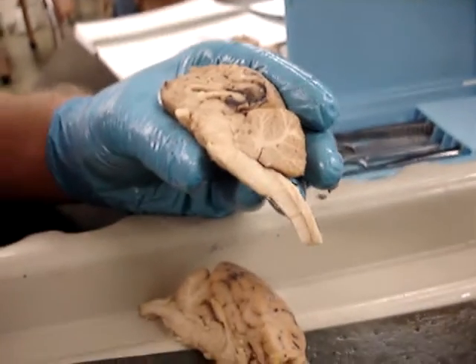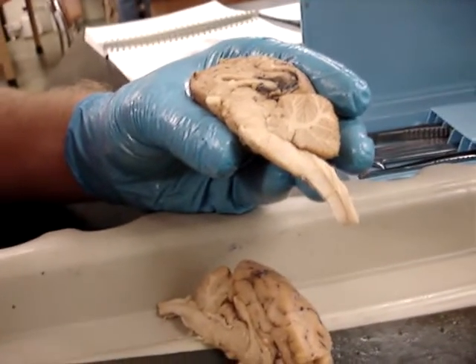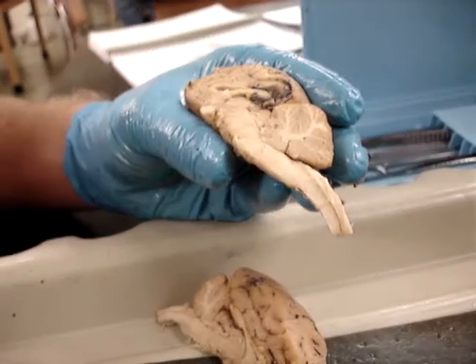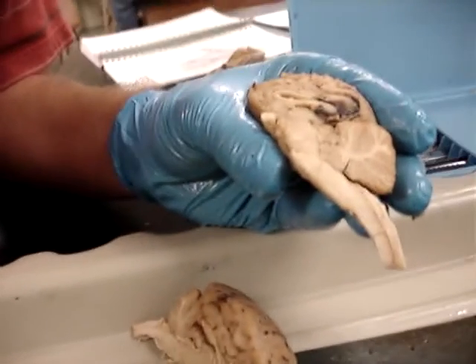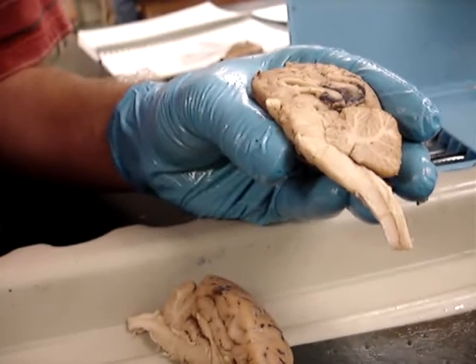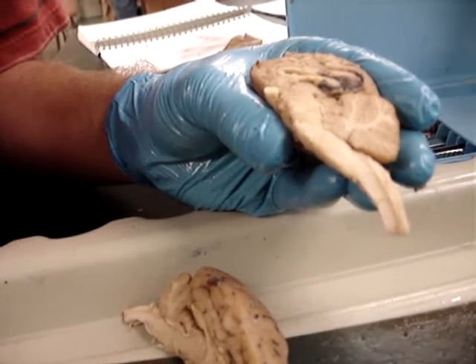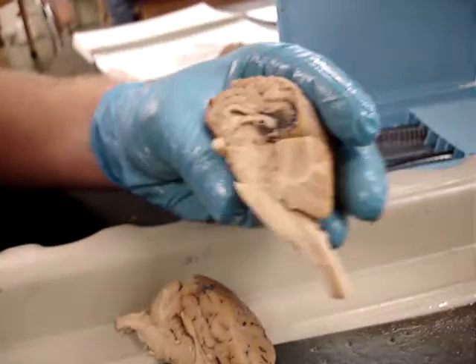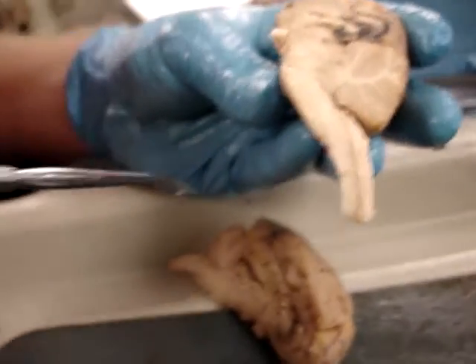The stuff inside is a really reddish color. It's what produces the fluid that bathes the spinal cord — it's called the choroid plexus. It's like a red, kind of spider-net-looking thing in there.